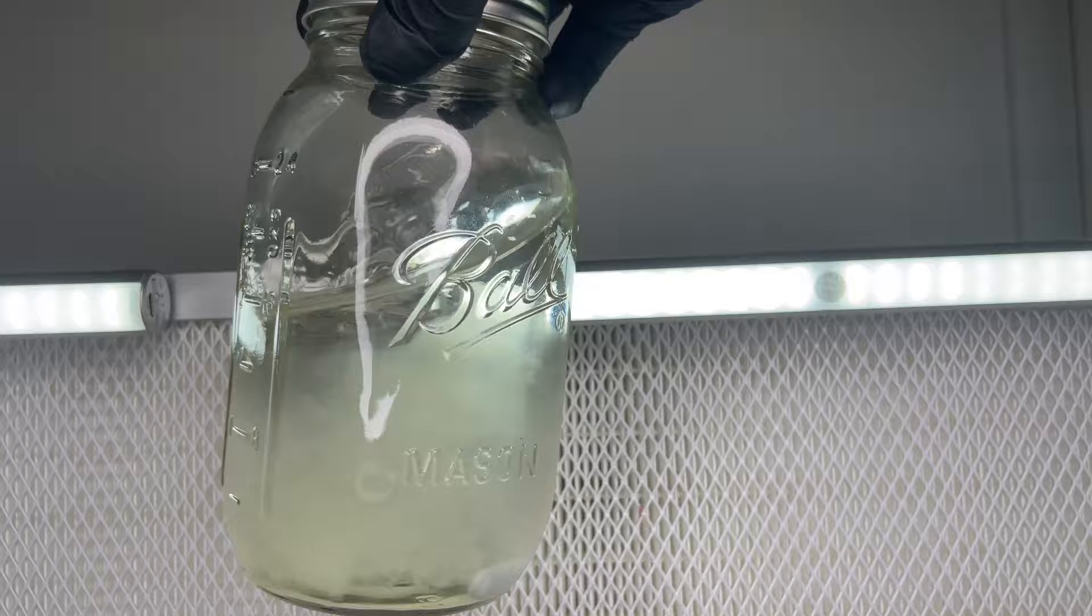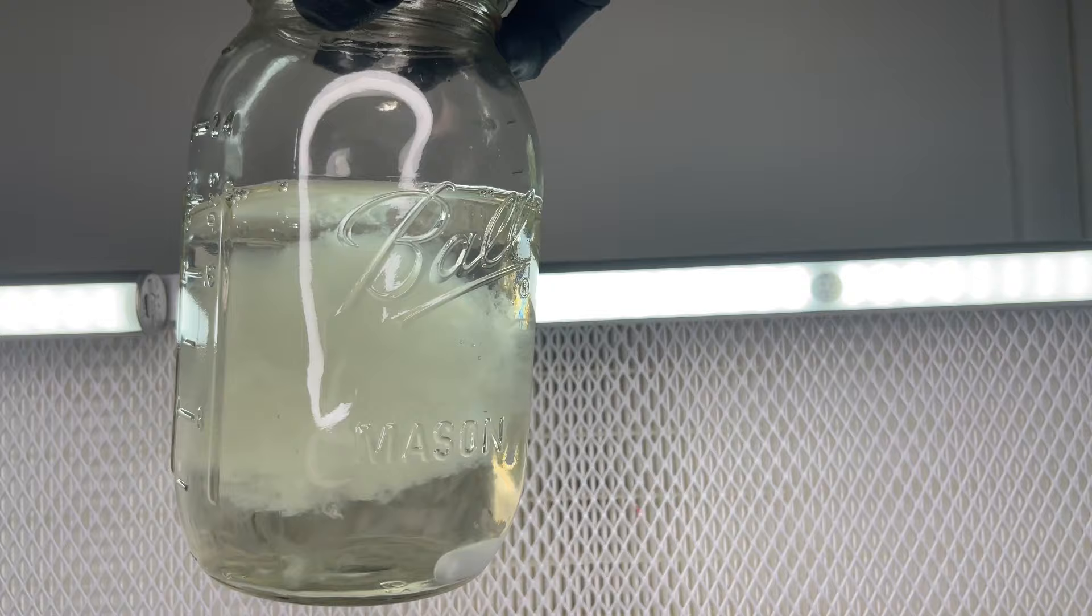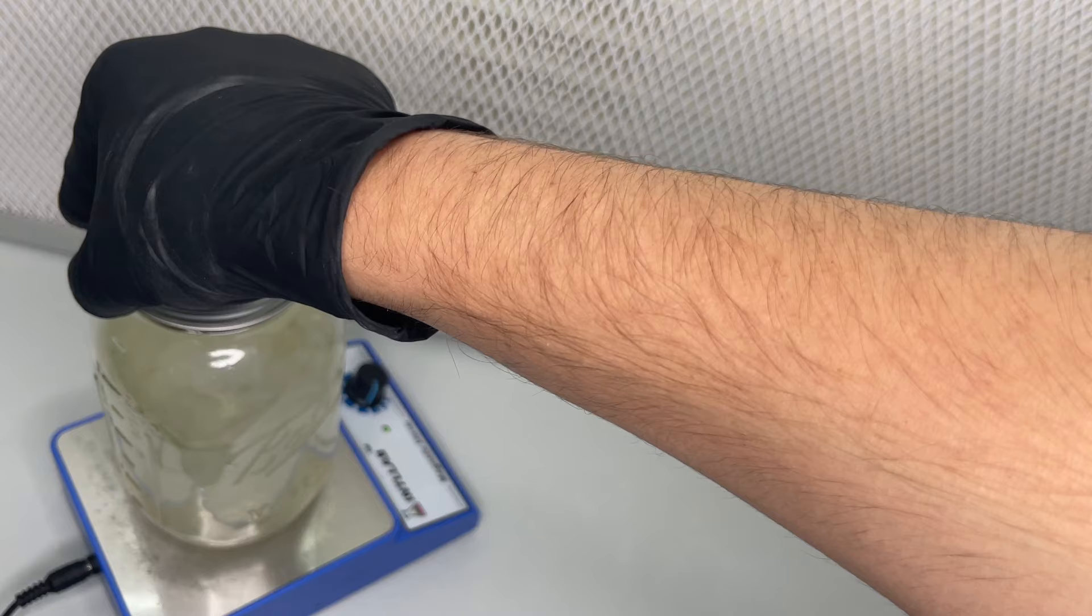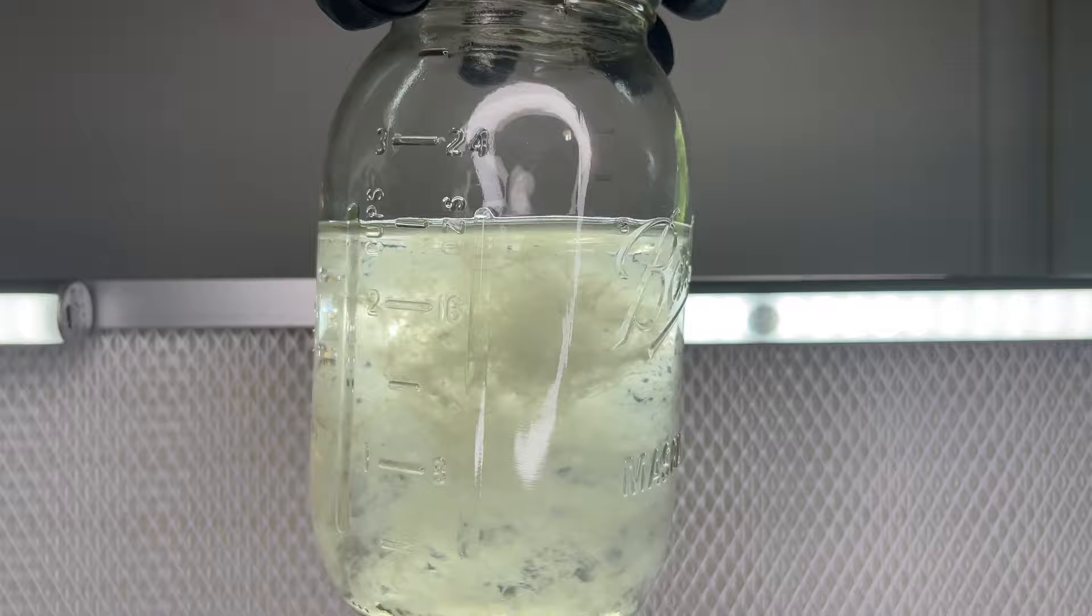Mushroom liquid culture media is a nutrient broth used to propagate mushroom mycelium. In this video, I'm going to show you my new favorite liquid culture recipe.